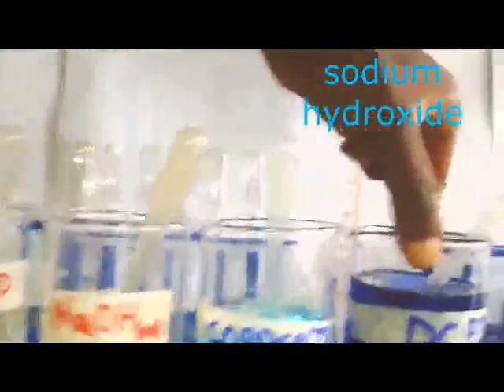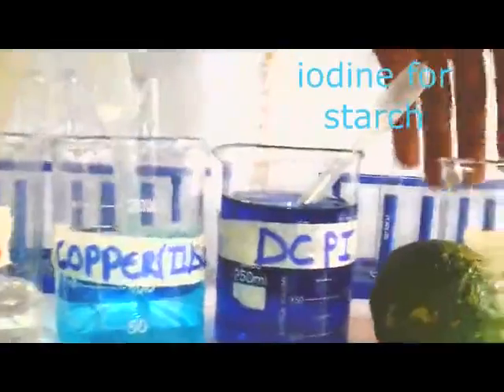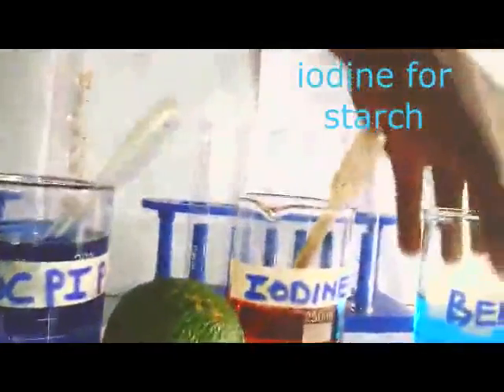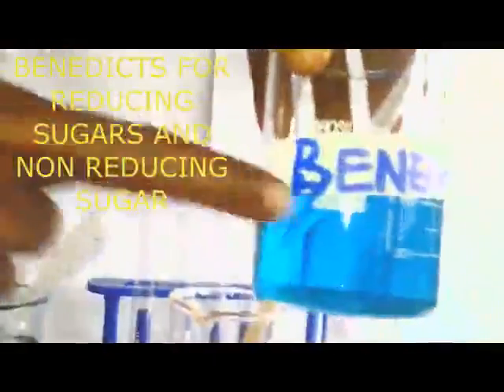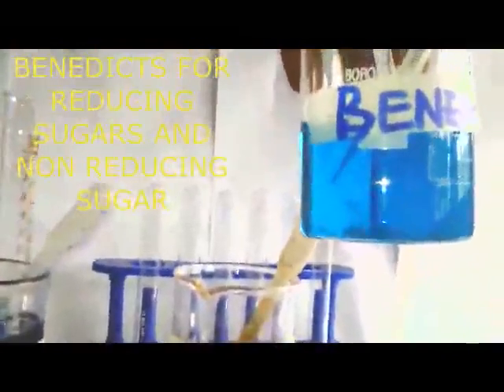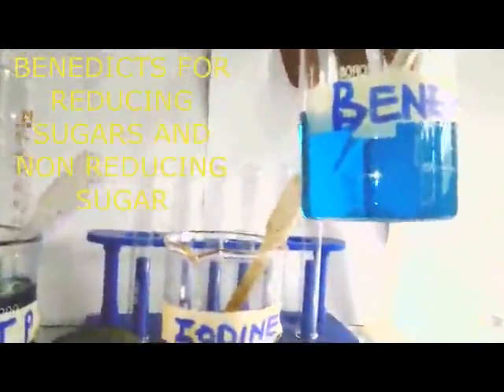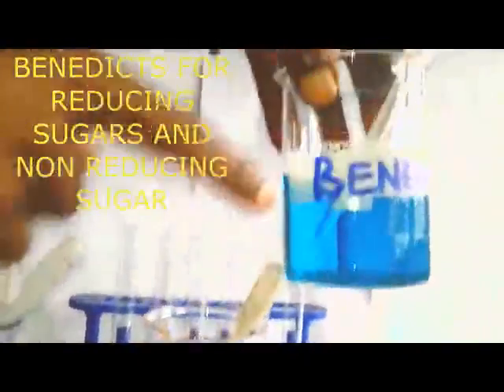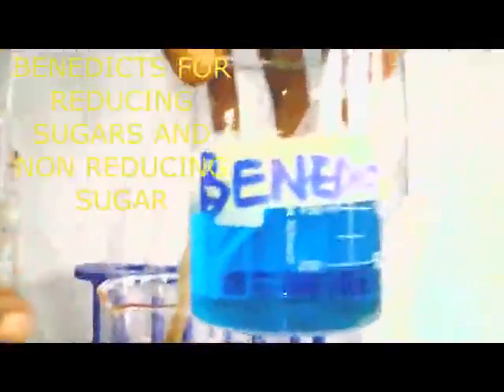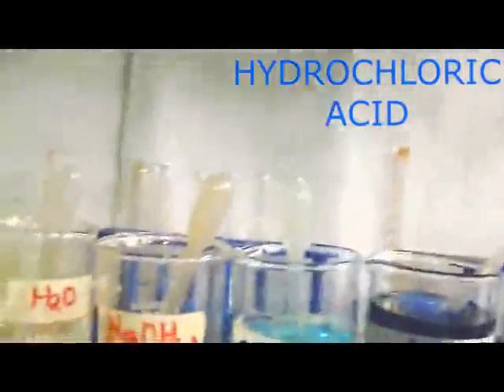This one is the vitamin C test, DCP-IP. Then this one is the starch test, or iodine test. Then we have Benedict, which is for reducing sugars as well as non-reducing sugars. We are going to see how we treat it when investigating each of them, like in Benedict's test, the reducing sugar test or the non-reducing sugar test. From there we have another vital reagent.